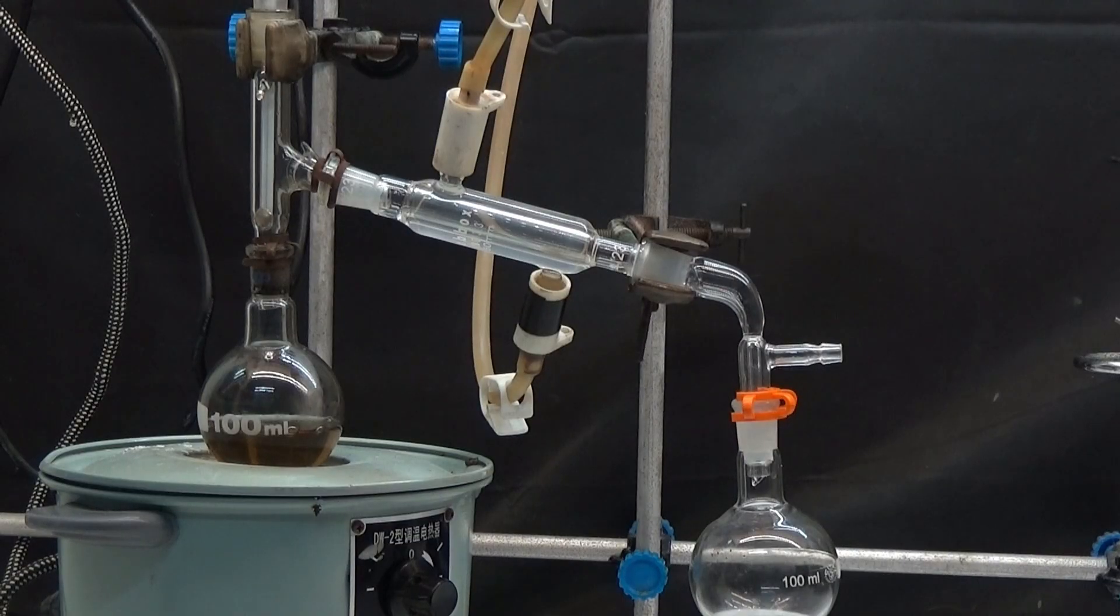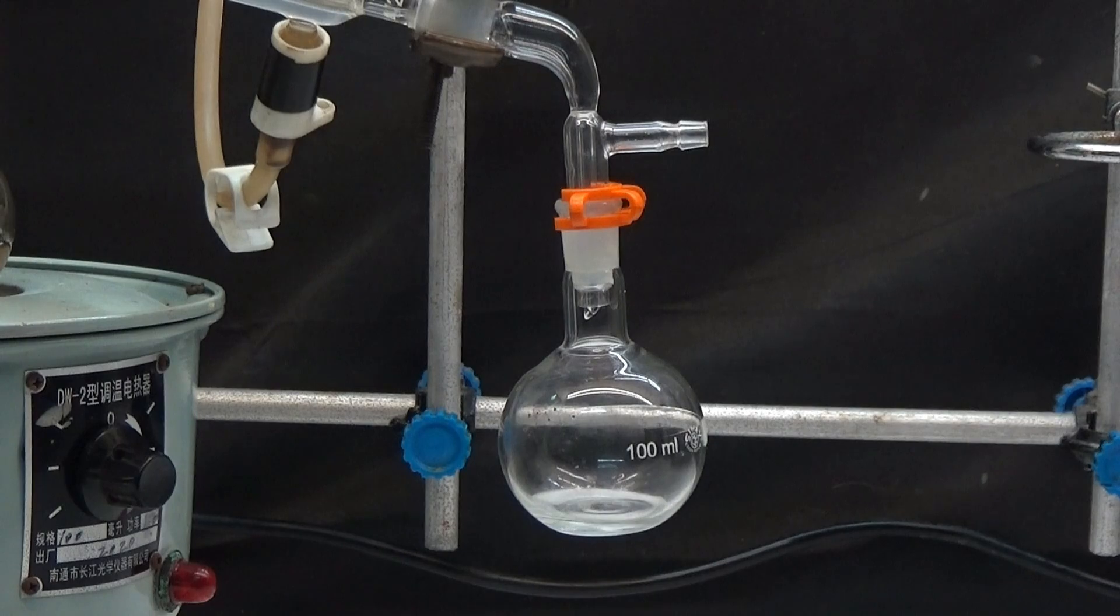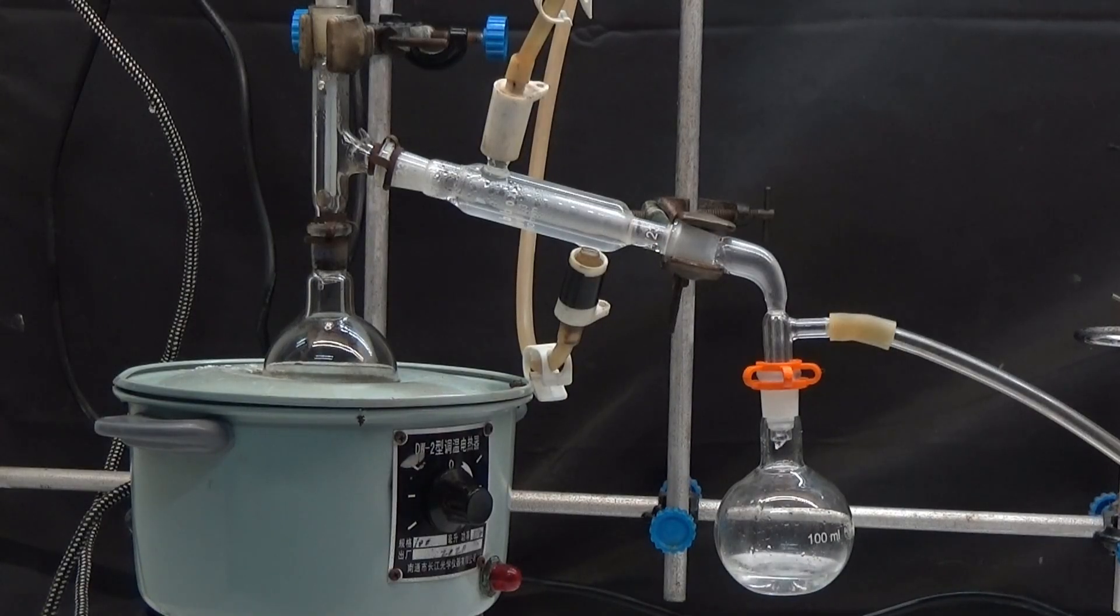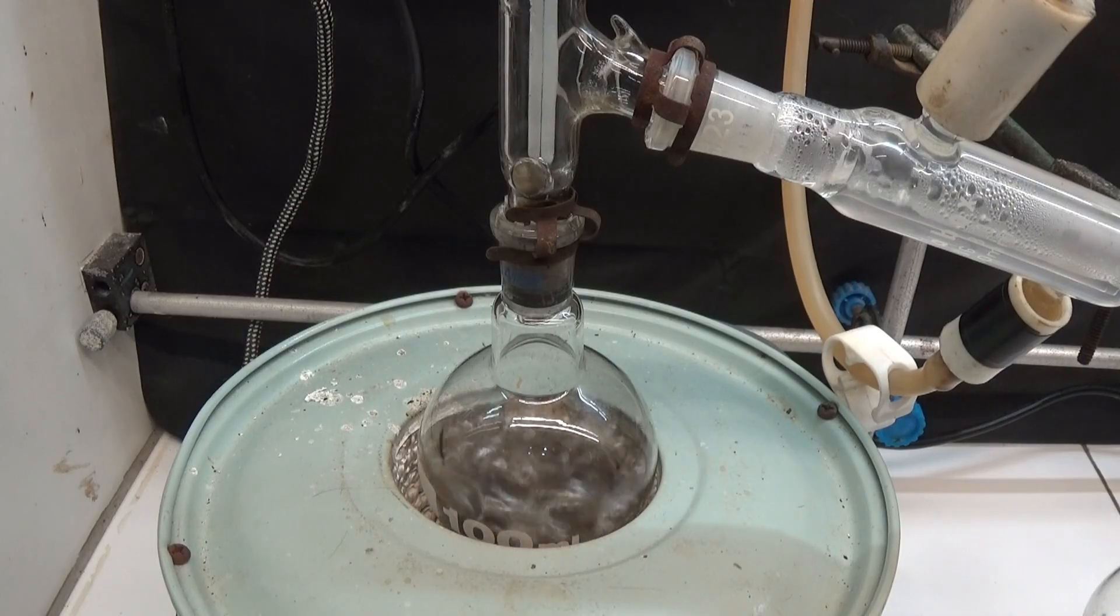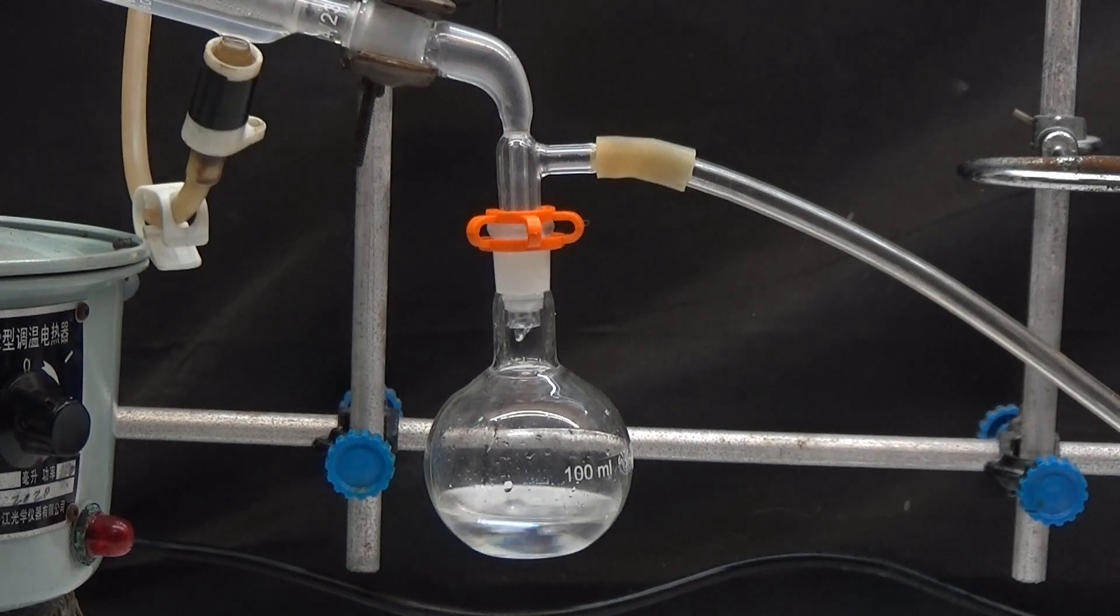At 34 degrees, distill all the ether first. The rest of the product is vacuum distilled. This time, the liquid ester is obtained that distills at a temperature between 200 and 220 degrees at 80mm.